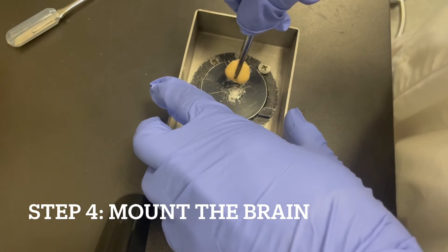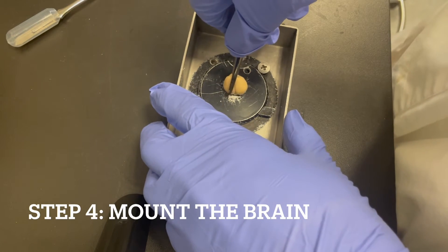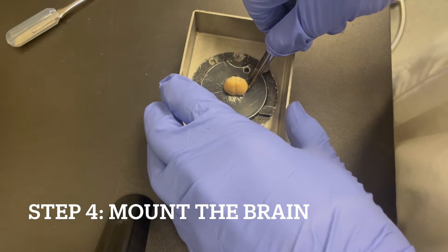Then transfer the brain to the center of the stage with a drop of super glue in order to securely fasten it to the stage.